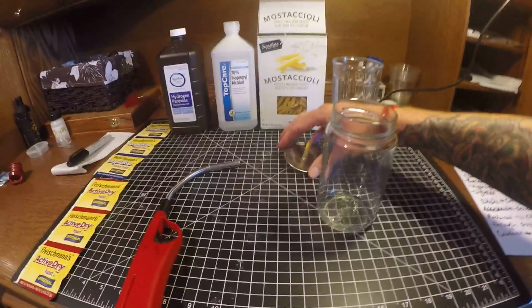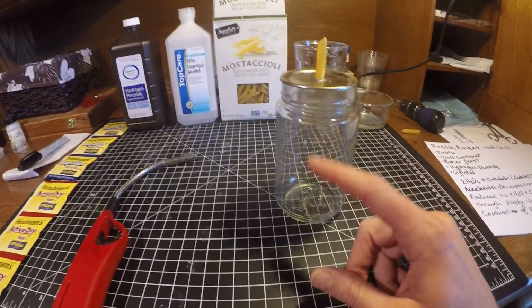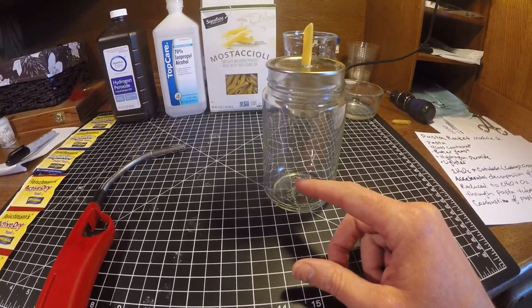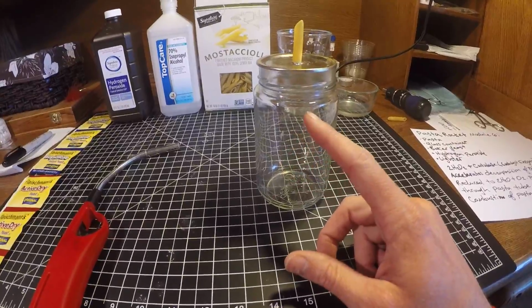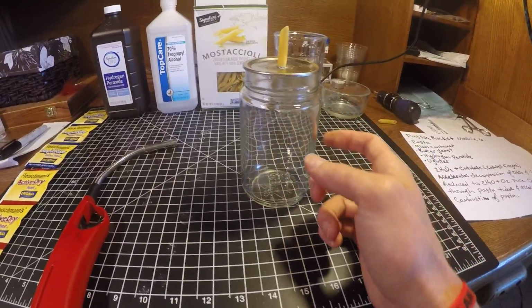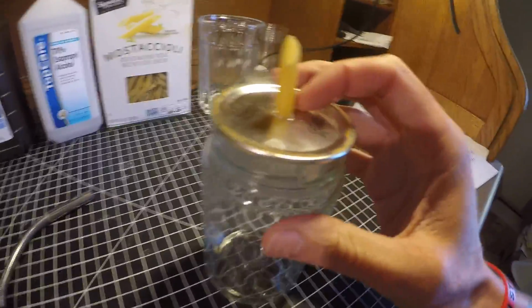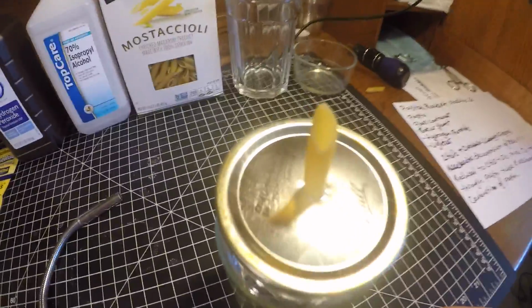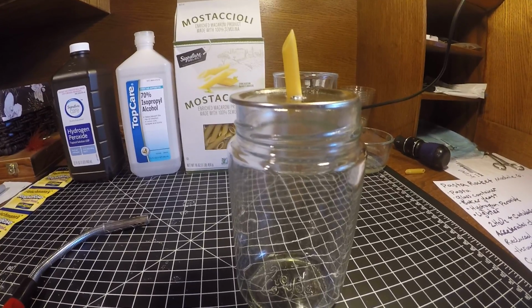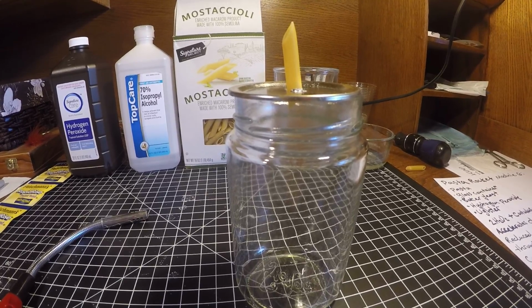So what we're going to be seeing is the hydrogen peroxide, the yeast, and the catalase degrading the hydrogen peroxide into water and oxygen. It's going to be producing water that's going to remain within the container, and the O2, as it bubbles, is going to be forced out of this little hole in the pasta. And that oxygen being released is going to be a part of our combustion that's occurring with the pasta.